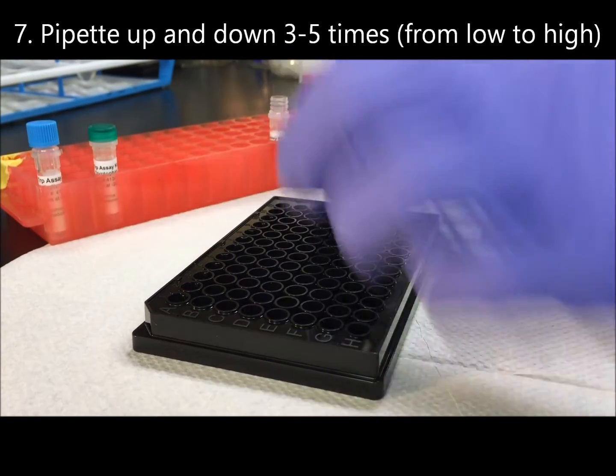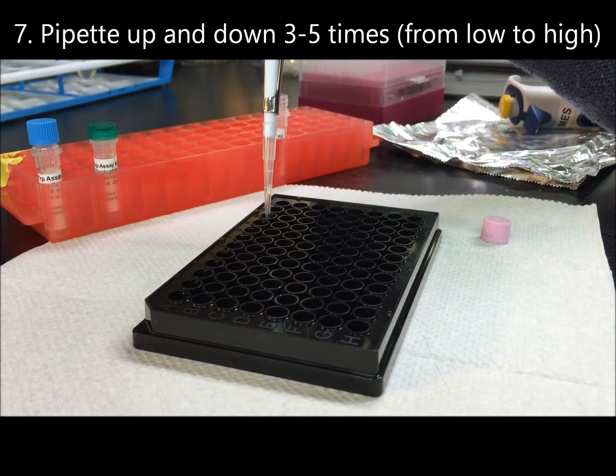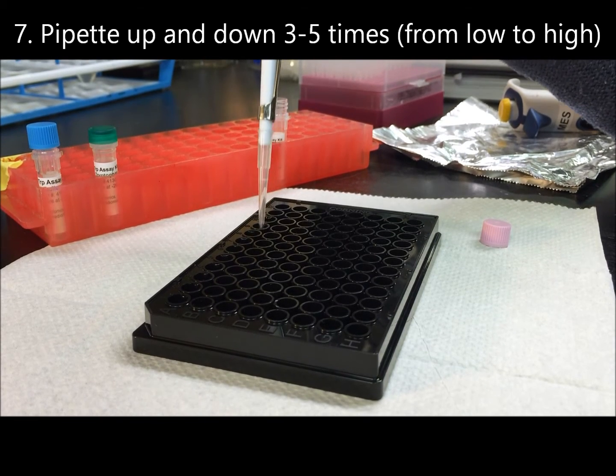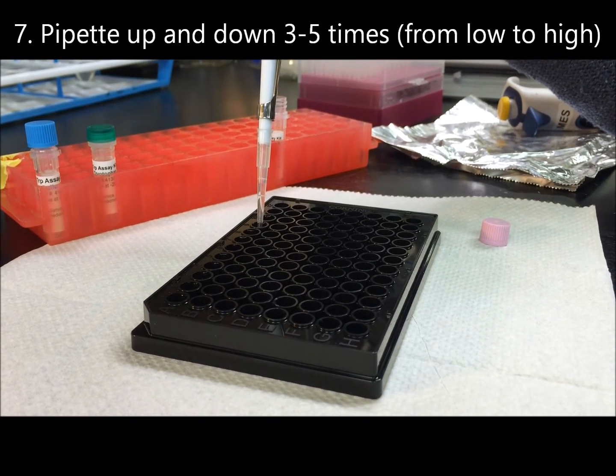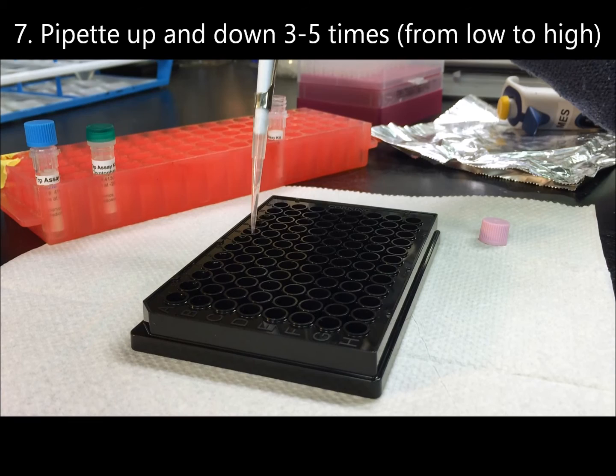Begin again from the lowest concentration, pipette up and down 3 to 5 times. Pipette gently to avoid bubbles.